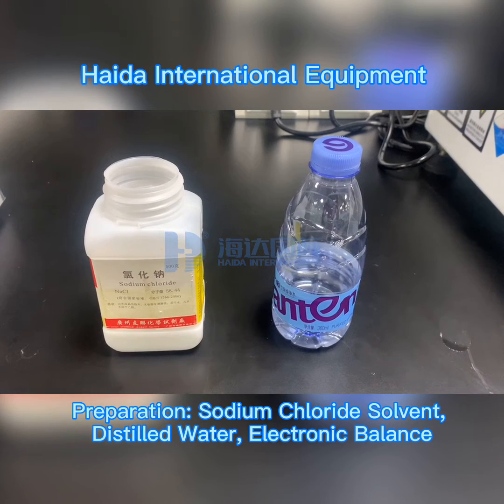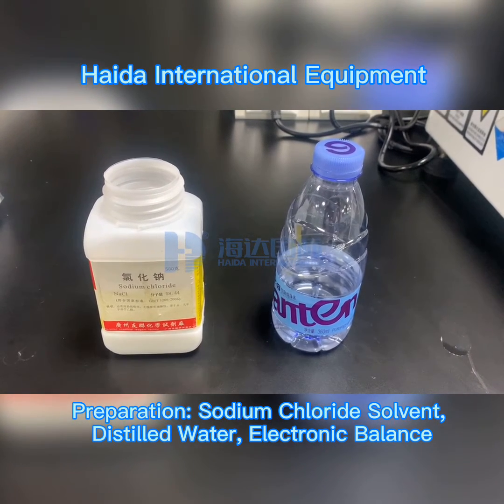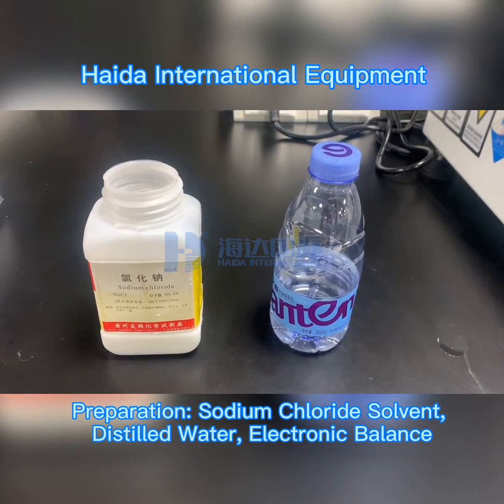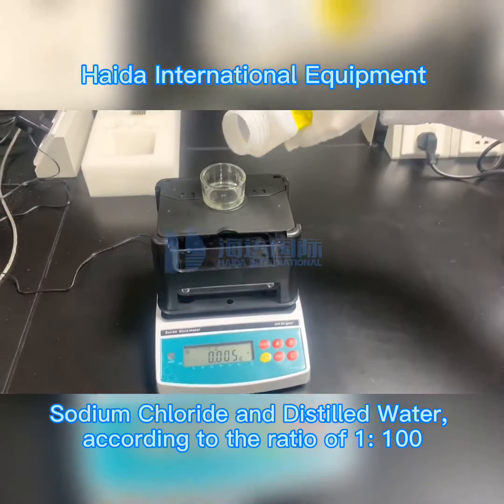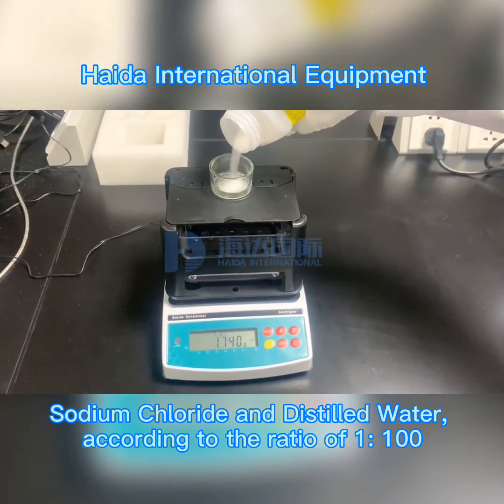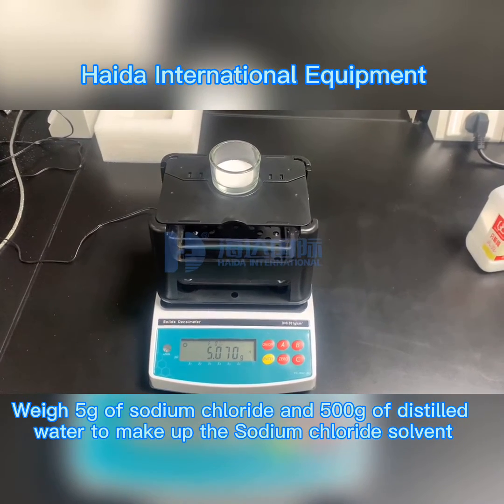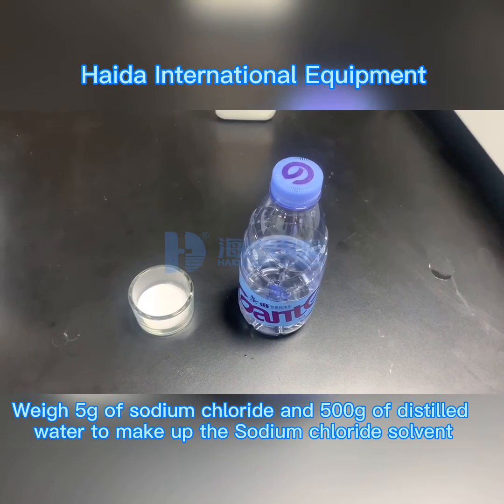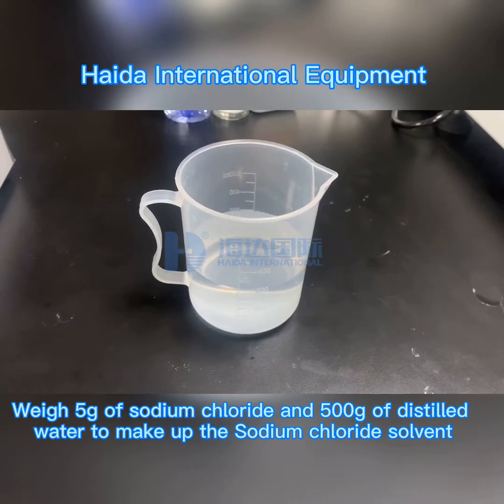Preparation: sodium chloride solvent, distilled water, and electronic balance. Prepare sodium chloride and distilled water at a ratio of 1:100 — weigh 5g of sodium chloride and 500g of distilled water to make up the sodium chloride solvent.